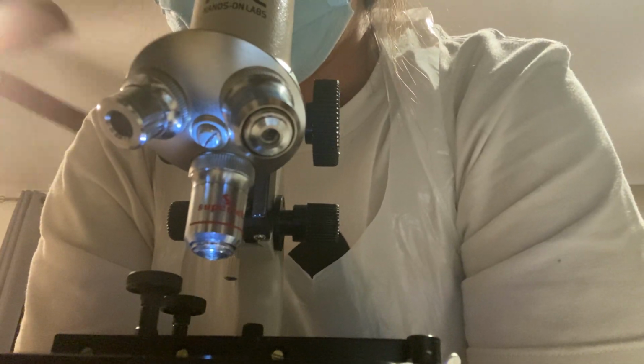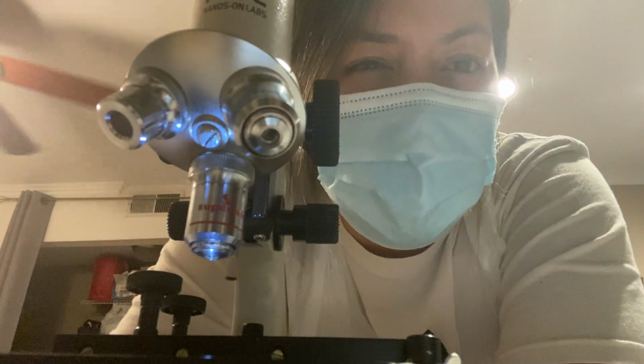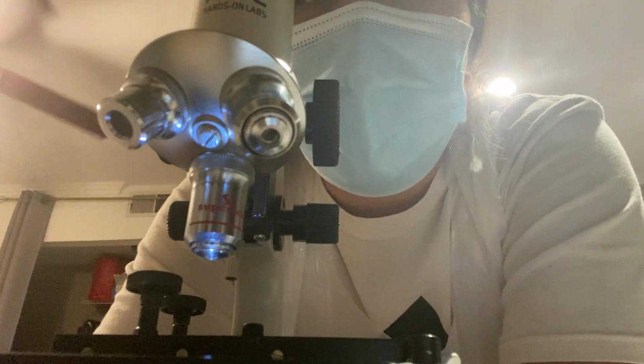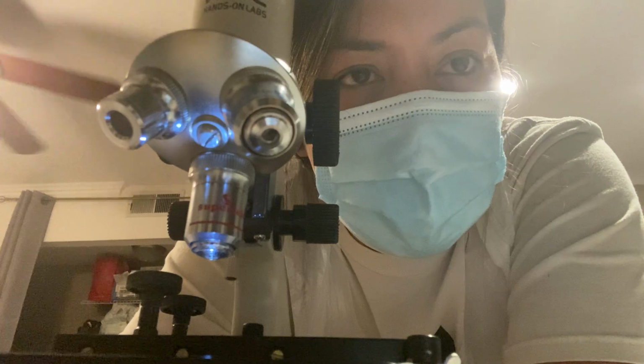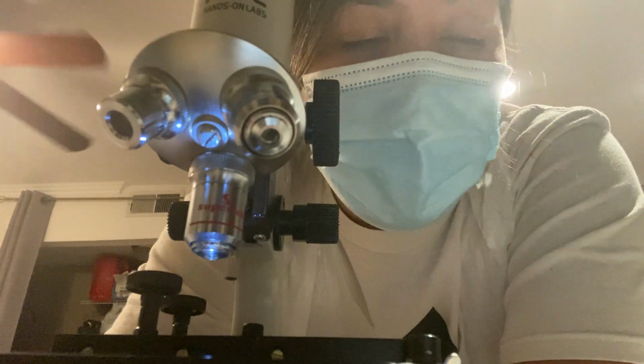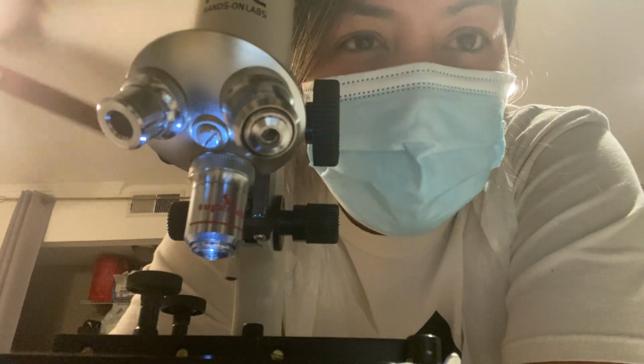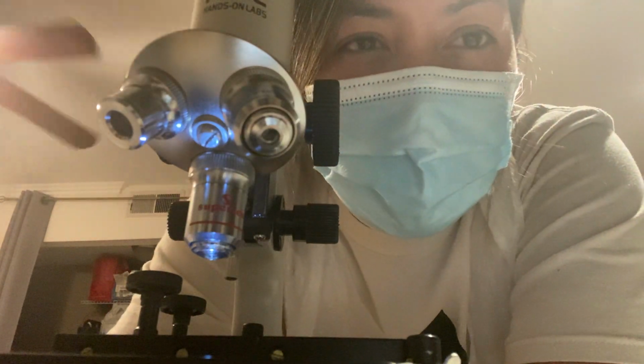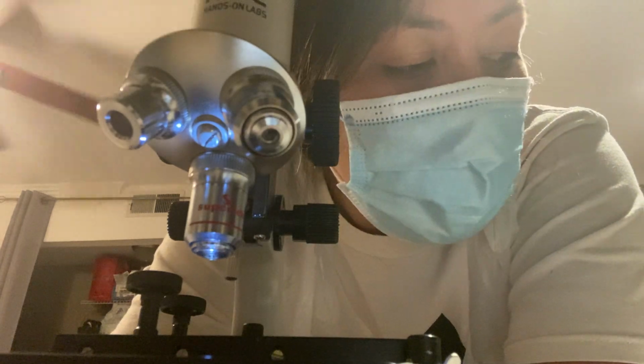I don't know if I was supposed to see any specific color exactly, but a lot of them just looked very opaque, and the background was white. But the outline of the cells looked more of a grayish color. I would say with the S. epidermidis, that's the only one that kind of had a violet tinge a little bit.